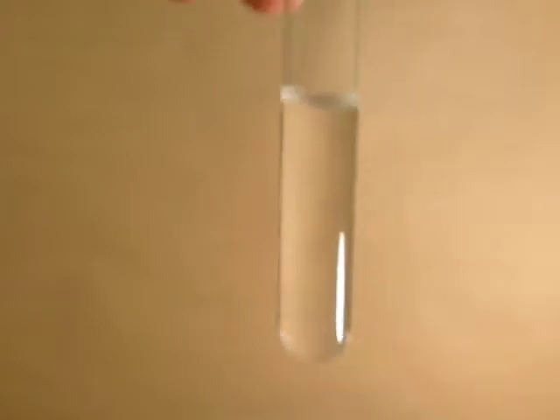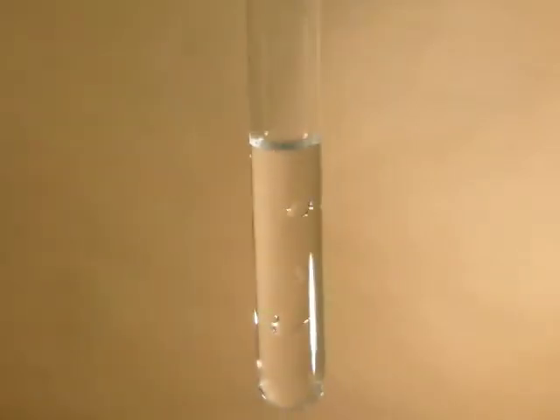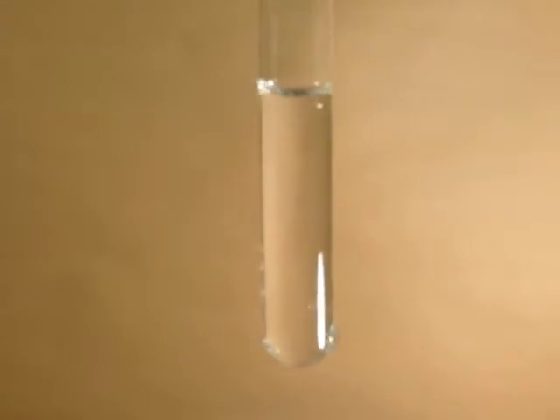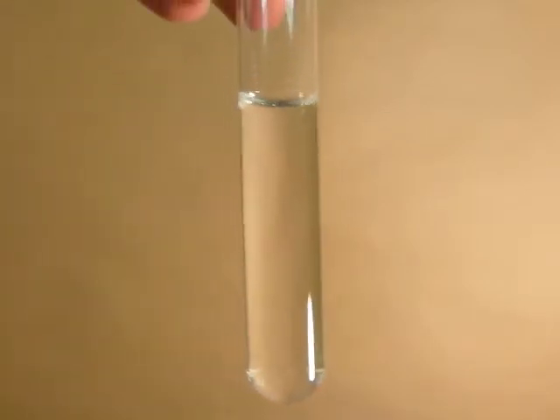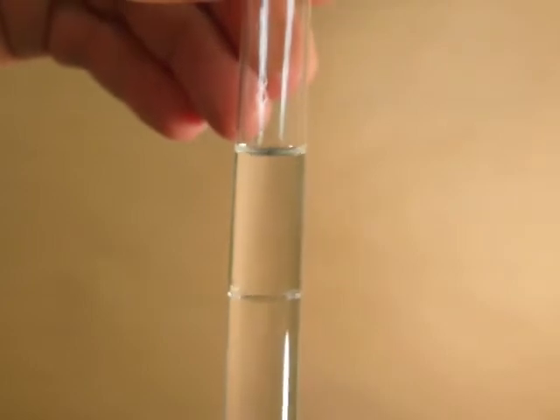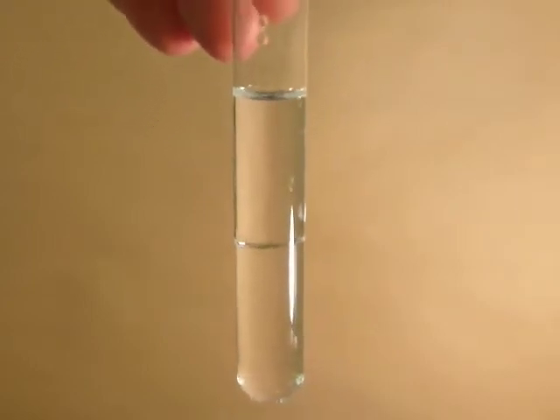So looking at the first one, where formaldehyde and water are mixed, clearly they mix, there are no layers, so I'd record a Y for yes, they mix. And the next one, going down, that was formaldehyde and acetone. There are no layers forming here, so those 2 can mix. I'd record Y for yes, they mix. And the third one down, glycerin and formaldehyde, no layers here. These 2 can mix. And the last one, which is formaldehyde and decane, there's a layer there, so they do not mix. I'd record an N for no, they don't mix.